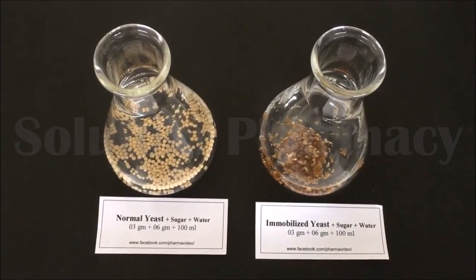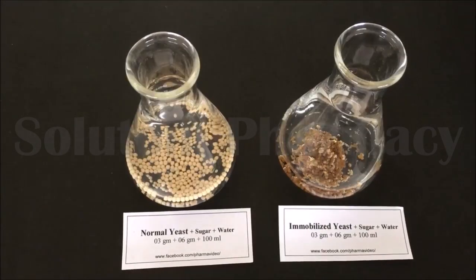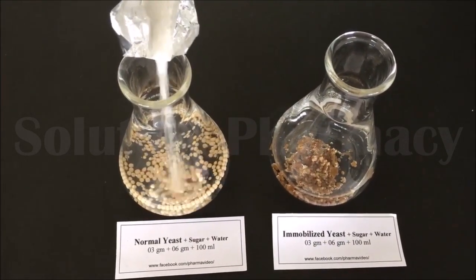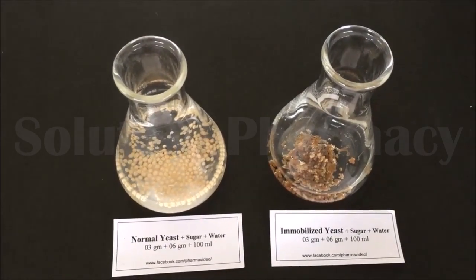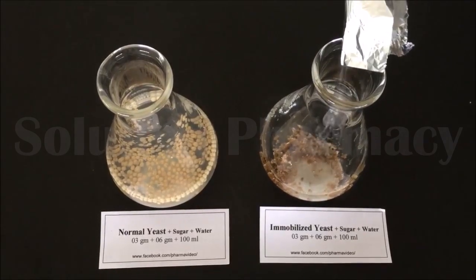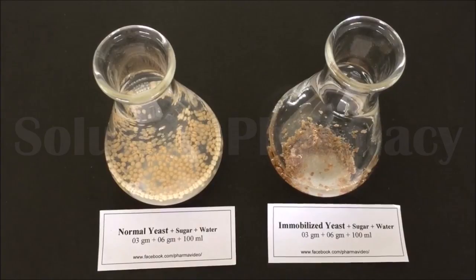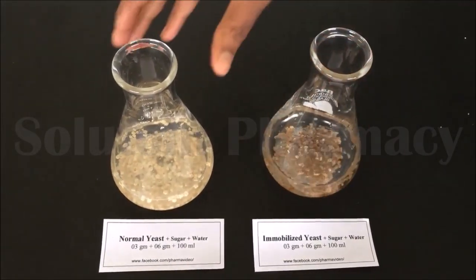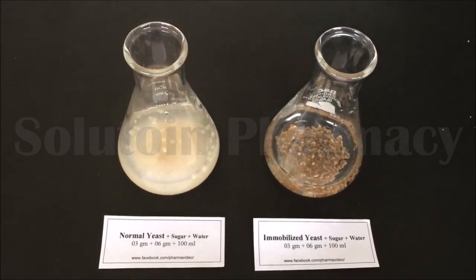In the second right side conical flask we have transferred 3 grams of immobilized yeast cell prepared in the previous experiment — yeast cell immobilized in sodium alginate. After this, transfer 6 grams of sugar to each conical flask, then gently shake both flasks to dissolve the sugar into the liquid.